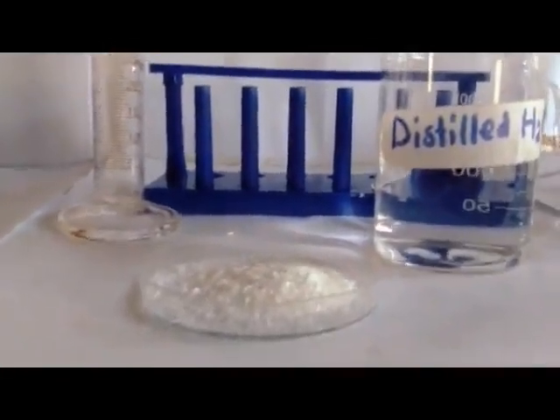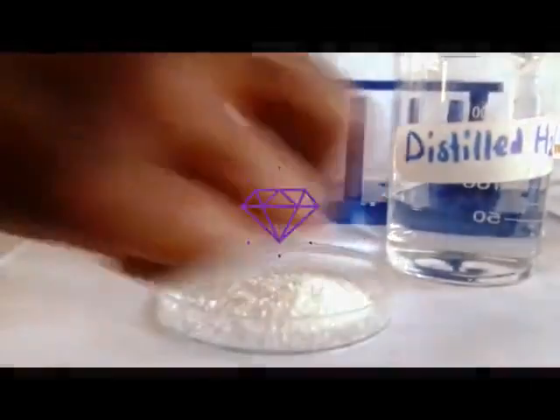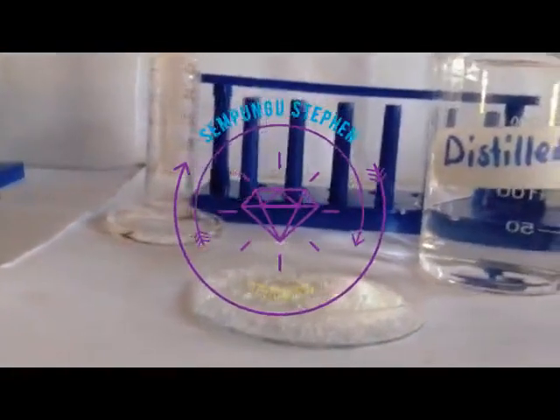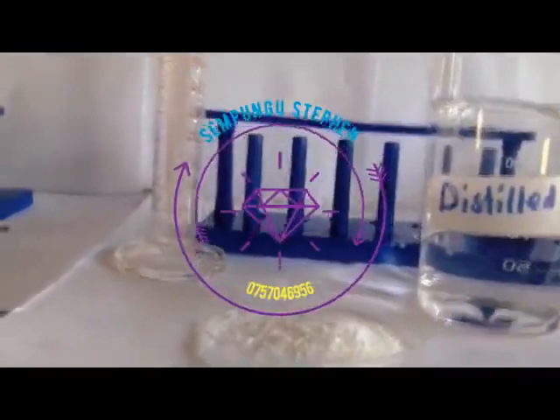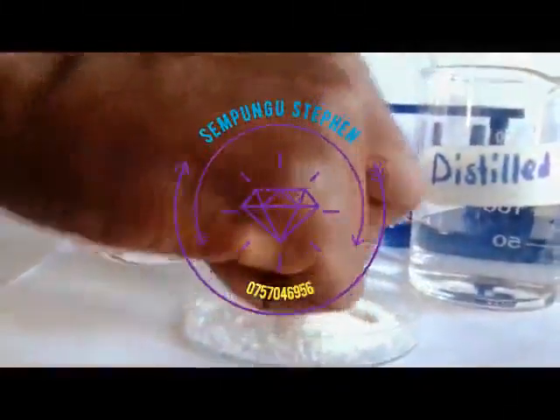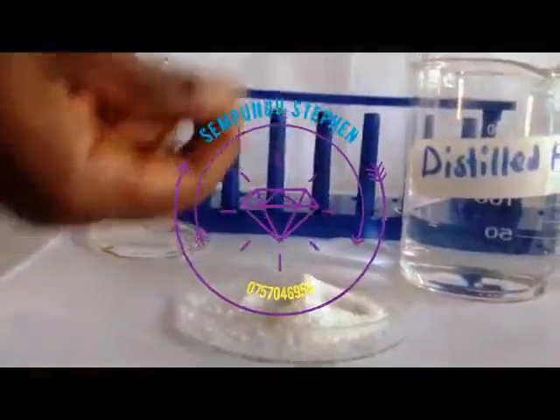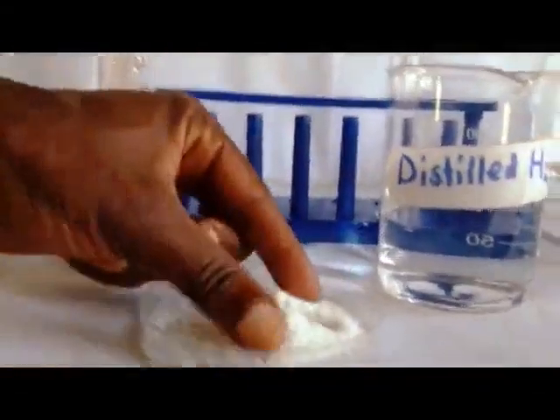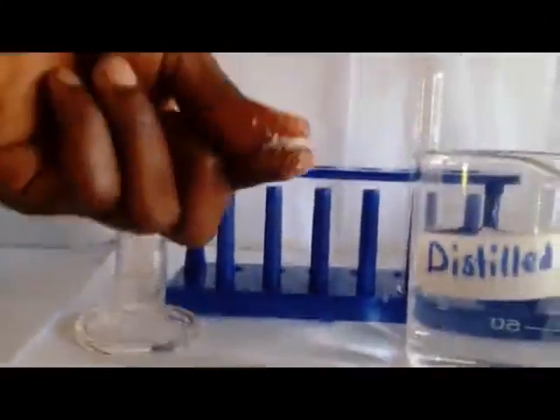So remember this order always: you need to follow up the test, then you record your observation, and then you record your conclusion or deduction. Remember, in chemistry, as you are recording your observation, we mainly focus on the color, the state, the texture.